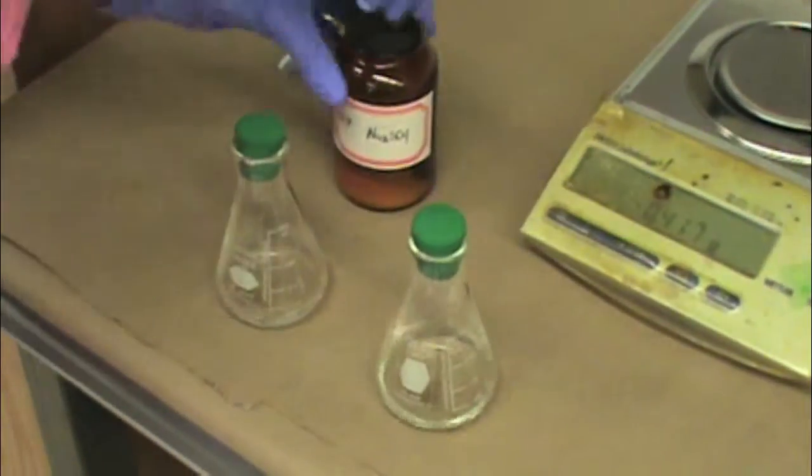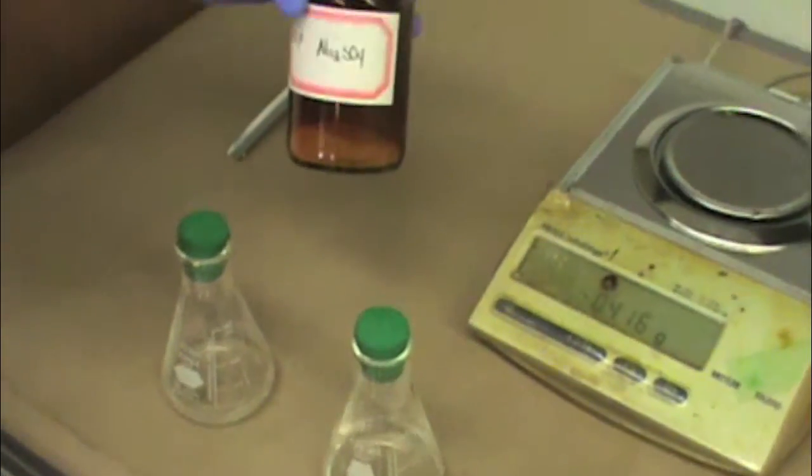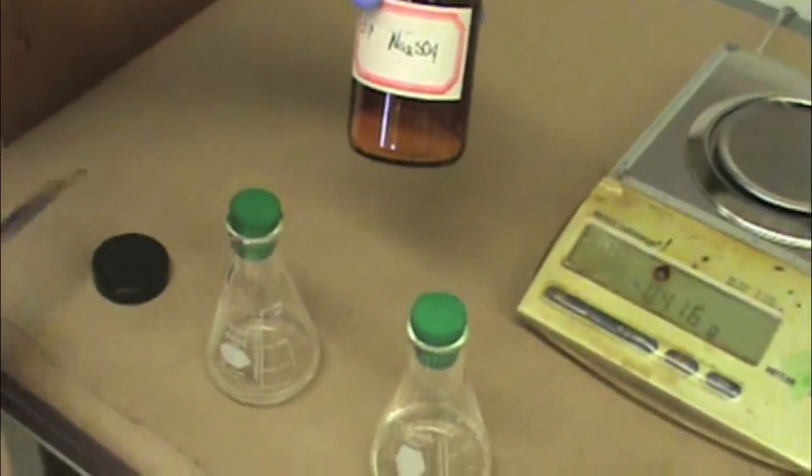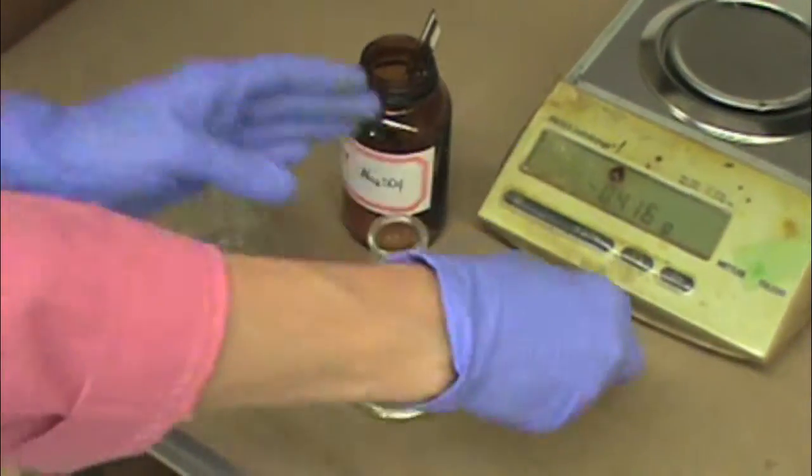So we have two samples here. In the first, we have slightly less water, so you'll see how that affects the sample. We will unscrew the sodium sulfate. You should always leave the cap on when not in use.